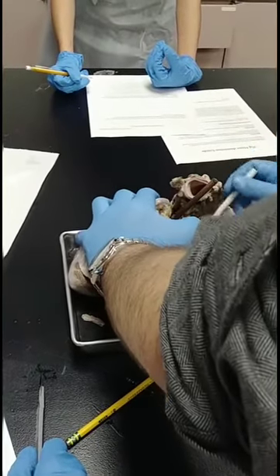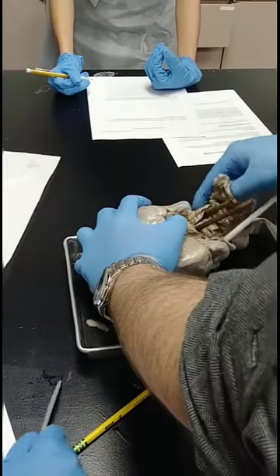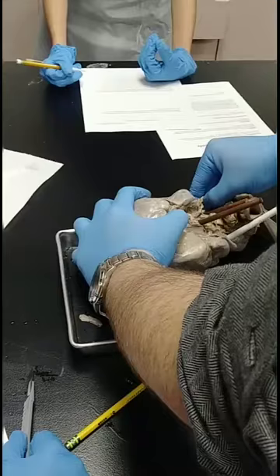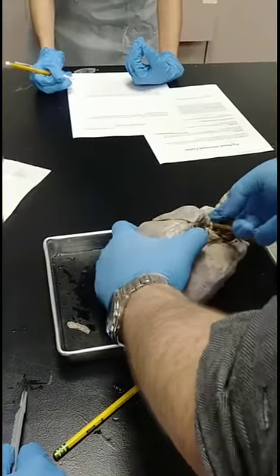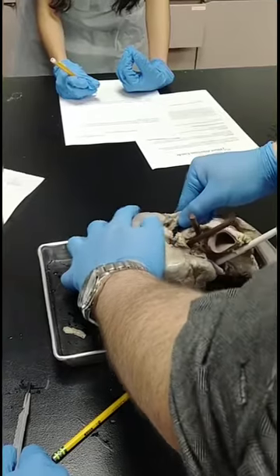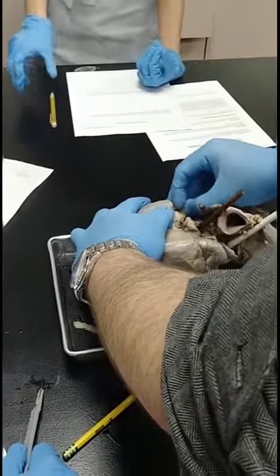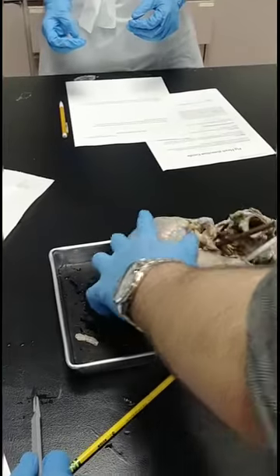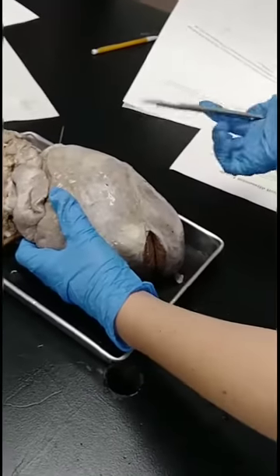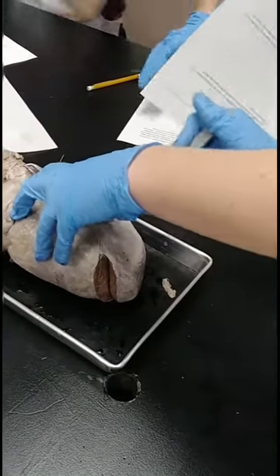Any questions so far? You found your aorta? This is another artery — it's the pulmonary artery. You can see where that goes. If it's thin like this, that's a vein. If it's thick like this, that's an artery. So this is the left ventricle — it's really muscular.